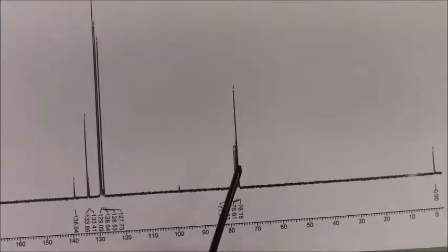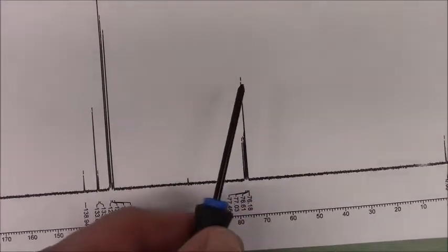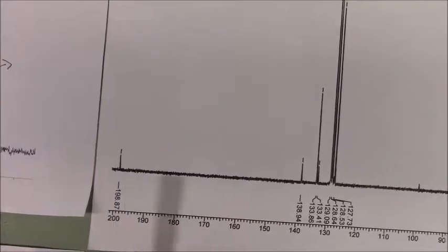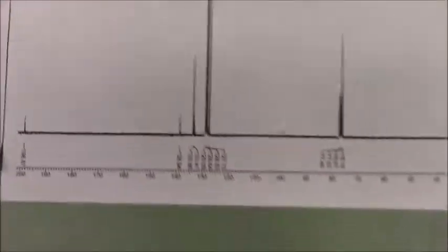This is an example from Sigma Aldrich. You can see how it's a little cleaner. See how they have less chloroform, so that one peak is taller. That belongs to that carbon. And you can see you get those two short carbons along with the carbonyl here. So it looks very much the same. That's your carbons. So now we'll move to discussion-based stuff.